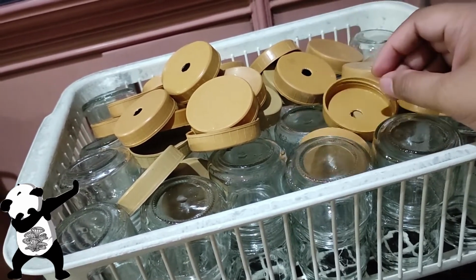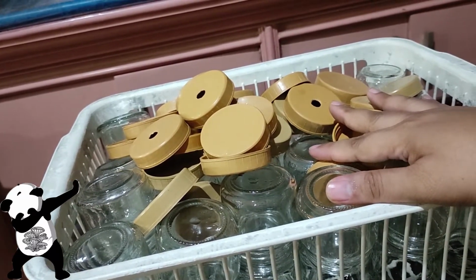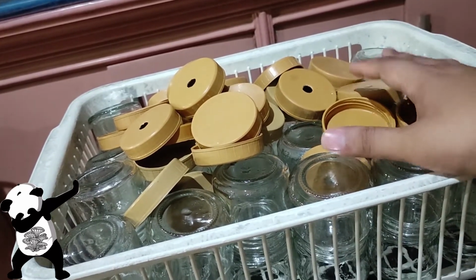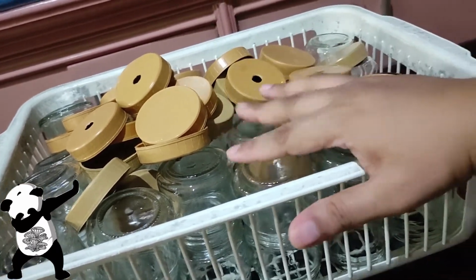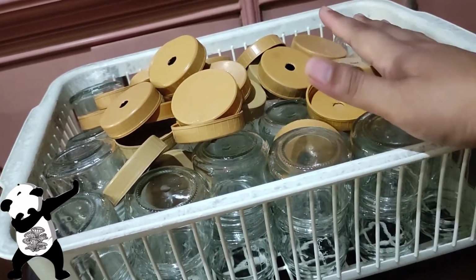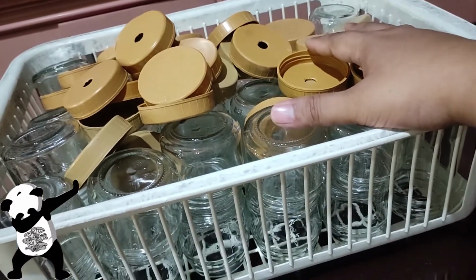And I'll be implementing that kind of process after cleaning the previous containers. I'm gonna coat them with vinegar for at least 3 hours, then rinse them, then let them dry again. So yeah, I'm just gonna update you. It's almost October, so the next batch of PDAs are on the October part, and that's it.